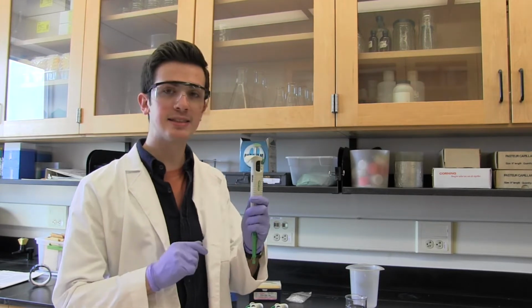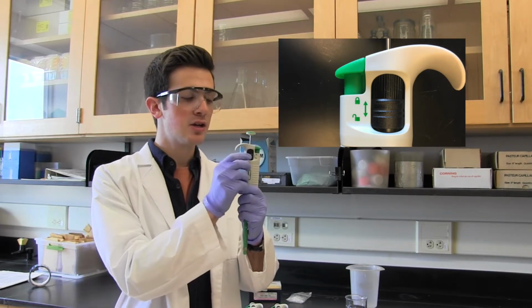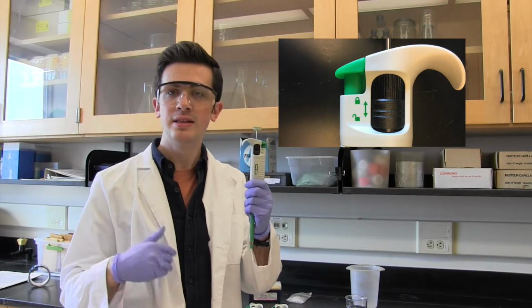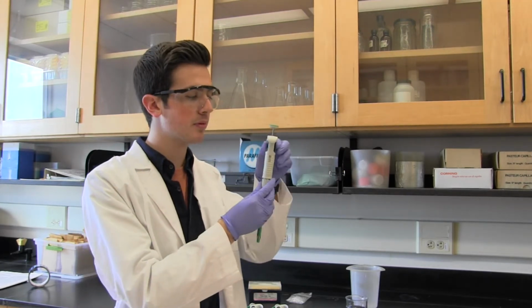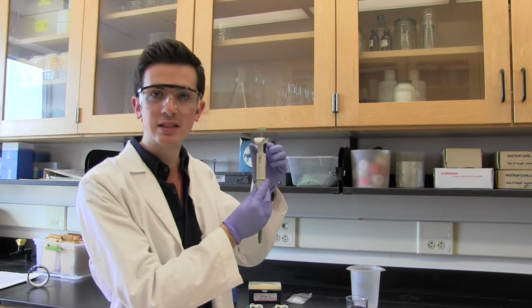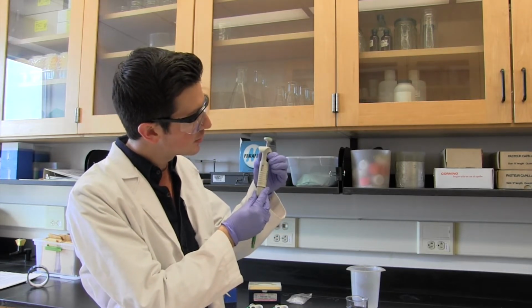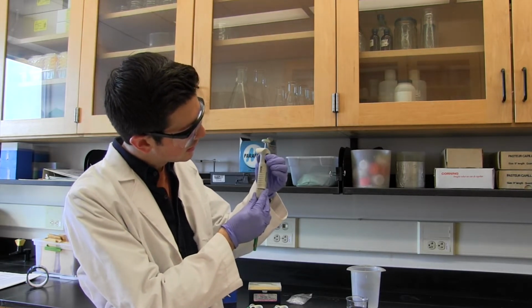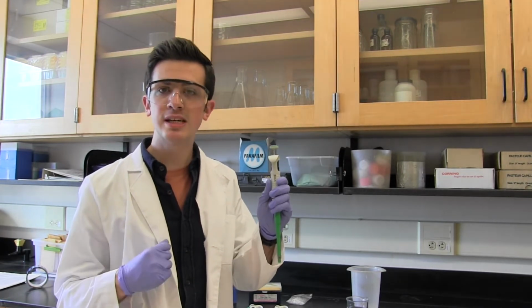Now, to adjust these settings, you'll notice there's 2 black rings on the side of your pipette. To adjust the first setting, depress the lower ring. You should hear a clicking noise or a release of air. This denotes that your pipette is now ready for adjustments. You can then rotate the upper ring. Rotating this upper ring in either direction will increase or decrease what the pipette has been set for. In this case, I'm lowering it from 730 microliters to 640 microliters. This isn't very difficult, and the ring rotates very easily.